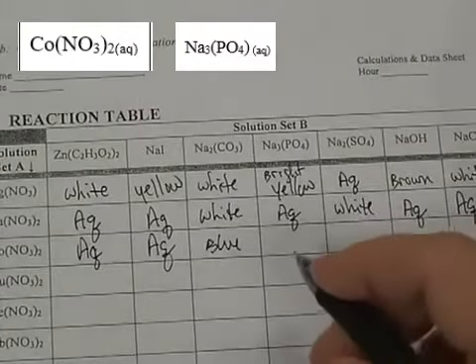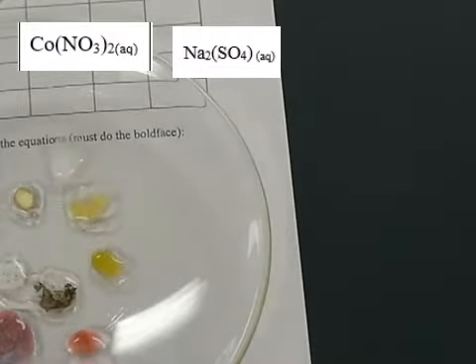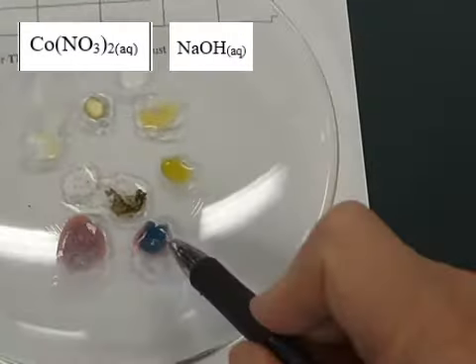Then for sodium phosphate, aqueous, that means it dissolves in water, nothing happens. Sodium sulfate, nothing happens with sodium sulfate. So that's aqueous. I'm going to jump to sodium hydroxide. See, now you can see the nice blue sodium hydroxide there.